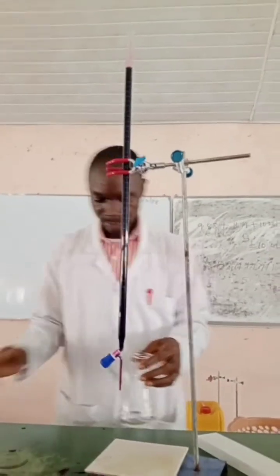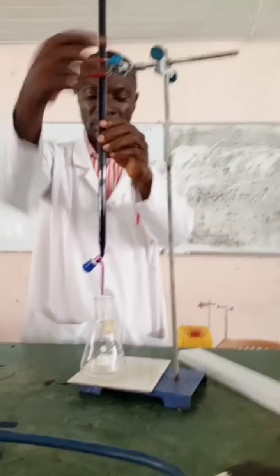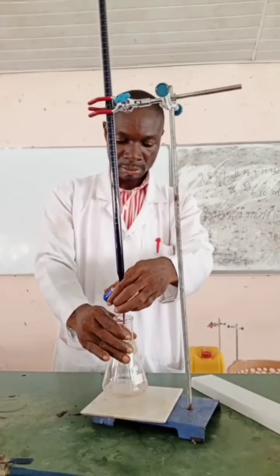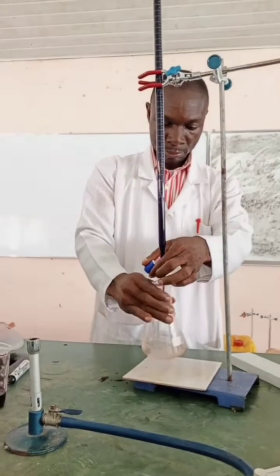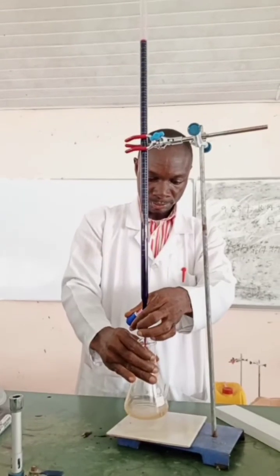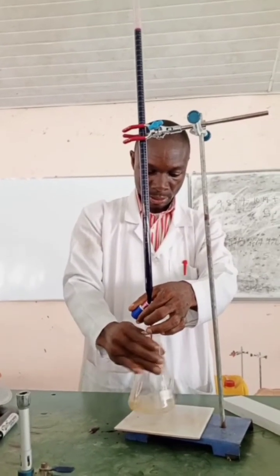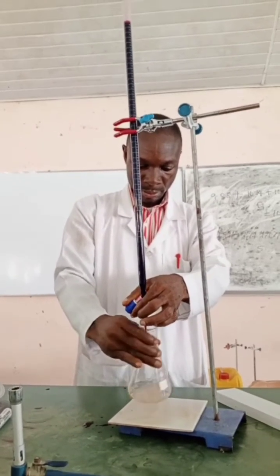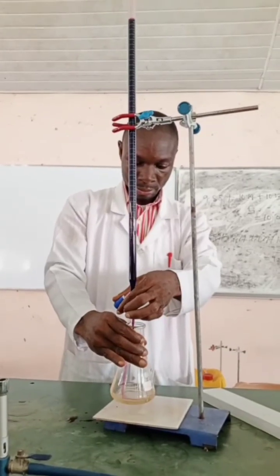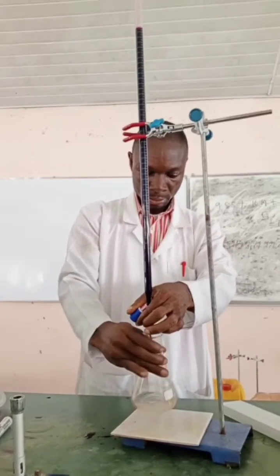We can start our titration now. It has to be dropwise — it is unlike normal titration, this has to be dropwise. Make sure when a drop of potassium permanganate is released, you swirl to discharge the pink color before an additional drop is added. If you continually add potassium permanganate without swirling properly to discharge the pink drop, it will encourage the formation of a brown color, which is manganese(IV) oxide, which is insoluble in aqueous solution, and your solution will turn brown instead of pink.